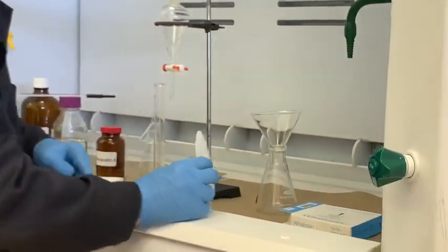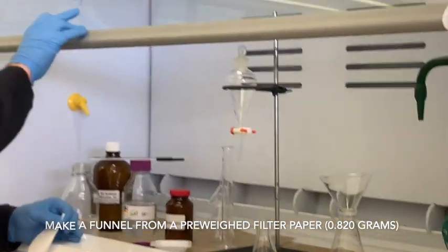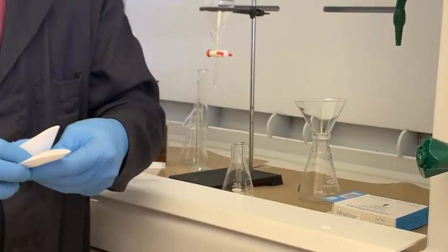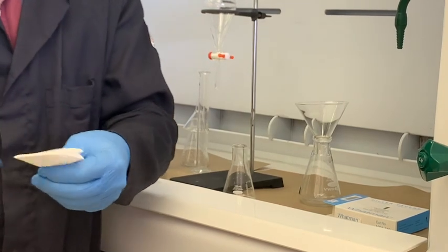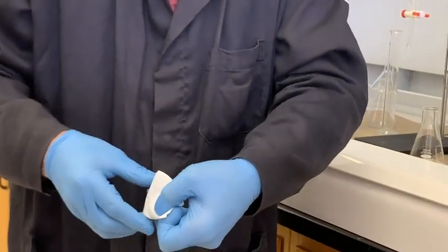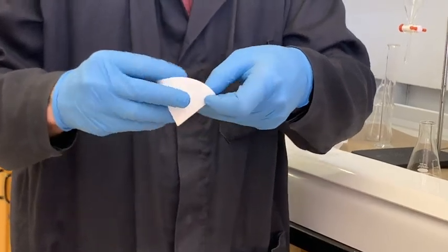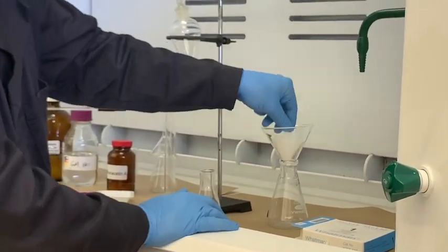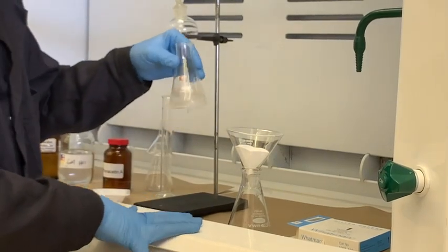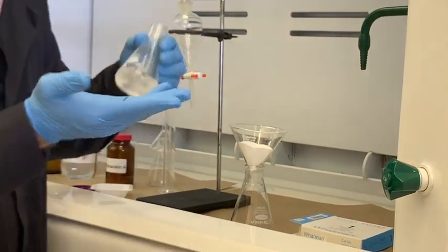To isolate the sucrose, we're going to take a little bit of filter paper, which I pre-weighed at 0.820 grams total. I'm going to fold it in half once, then fold it in half again. Now that I've folded it twice, I'm going to open one of the sides up to create a nice little cone filter. That filter goes in the middle of this funnel, and I'm going to gently pour this mixture through — making sure all of the solution lands inside the filter, otherwise it defeats the whole purpose.